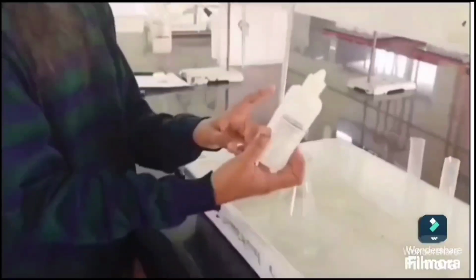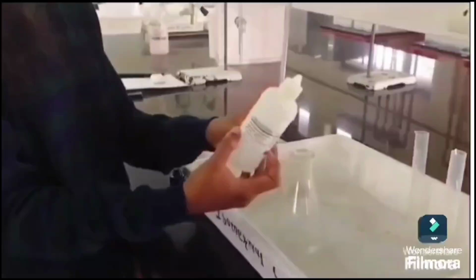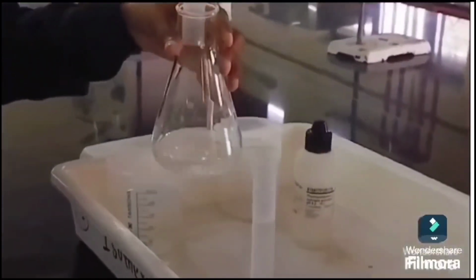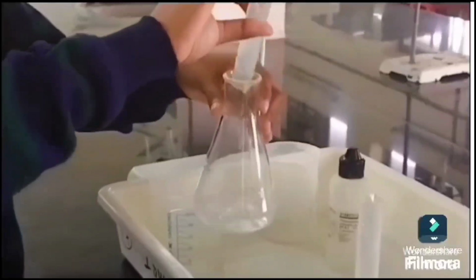Generating byproducts. If the experiments involve reactions where the byproducts or intermediates need to be analyzed, adding HCl may modulate secondary reactions immediately after taking the sample. These are the reasons. And now we are adding the HCl to the 20 ml sample in that same conical flask.